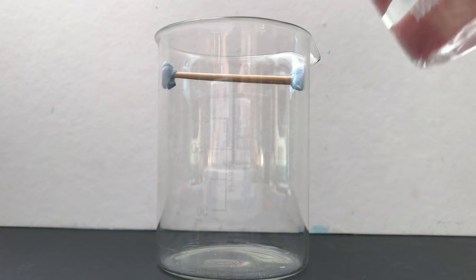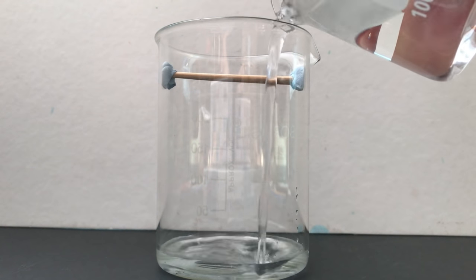To begin, we first add a small amount of a suitable solvent to the beaker.